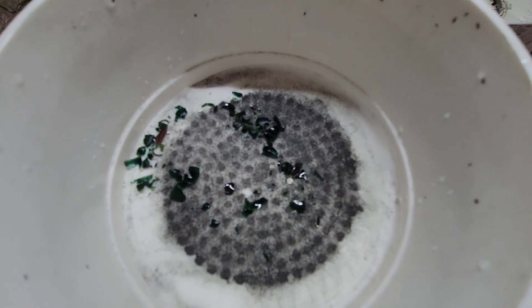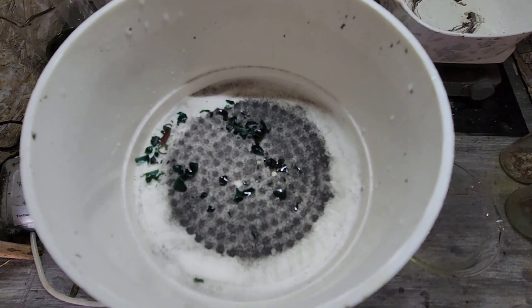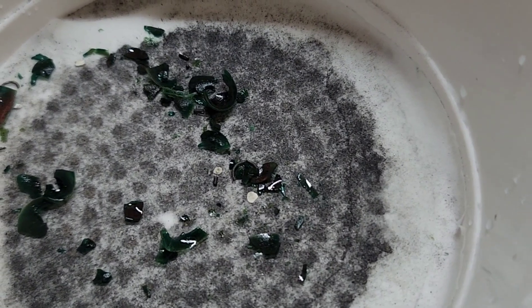Here is the filter shot. Get that to zoom in a little bit for you. There we go.